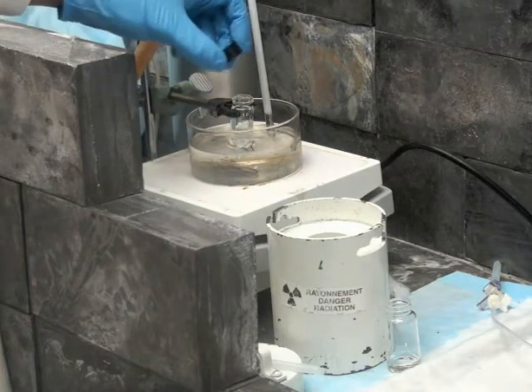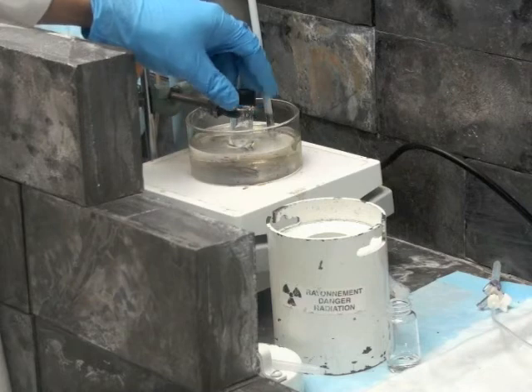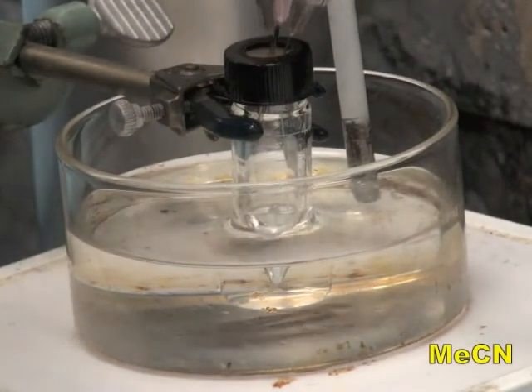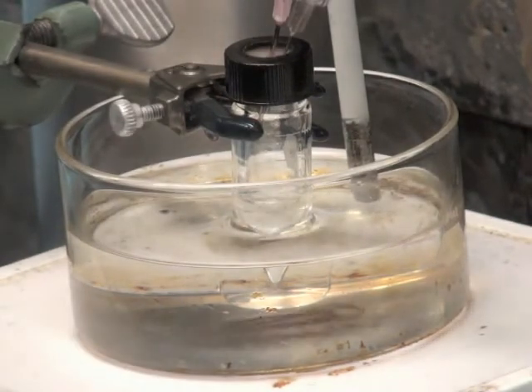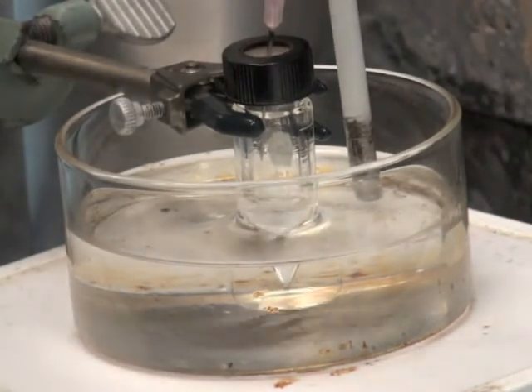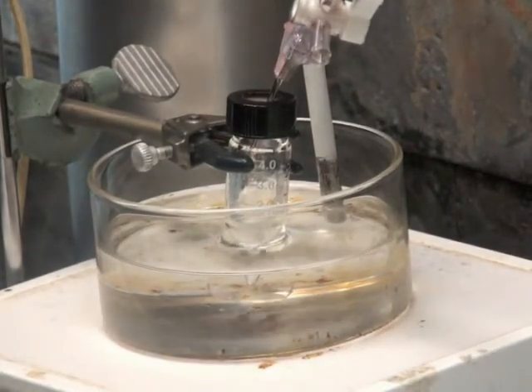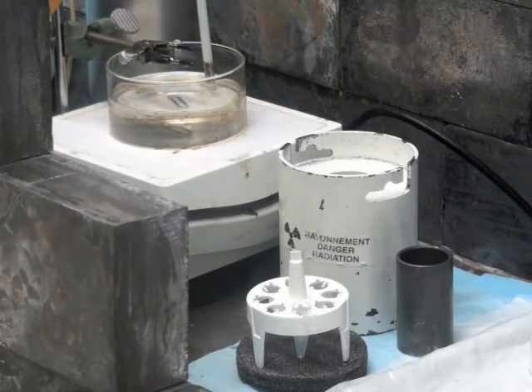Place the vial in a mineral oil bath heated to 90 degrees Celsius on a hot plate. In the event that an oil bath is not available, an aluminum block may be used. Remove the solvents under a gentle vacuum in a sweep stream of argon. Add acetonitrile to remove any remaining traces of water by azeotropic co-evaporation. Complete this step twice to ensure dryness. Once the solvents are visibly removed, stop the argon flow, set the vacuum to maximum, and dry for another 2 minutes. Finally, add acetonitrile to the dry residue to make a solution of highly reactive fluoride-18 anions with activity between 5 to 50 millicuries. This anion solution is used to label peptides and proteins alike.